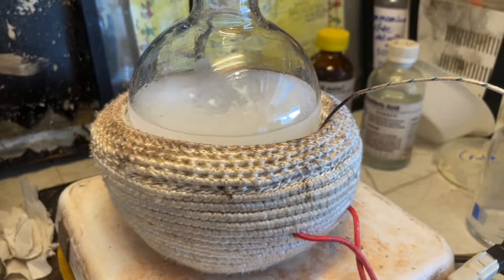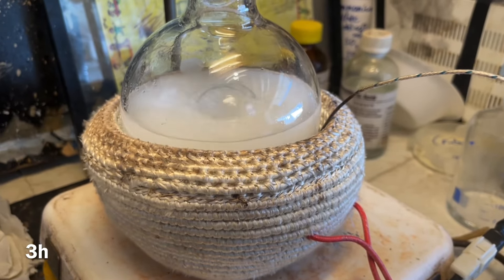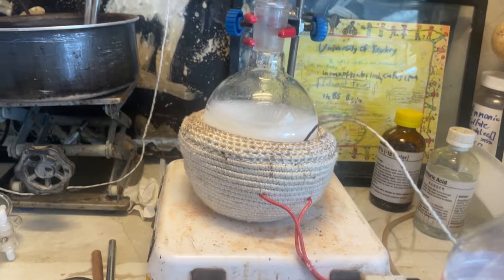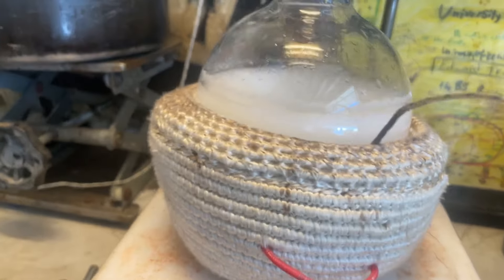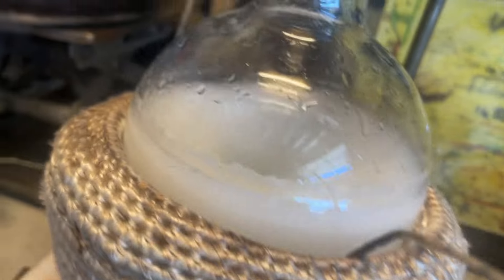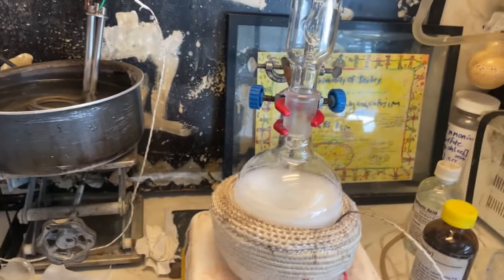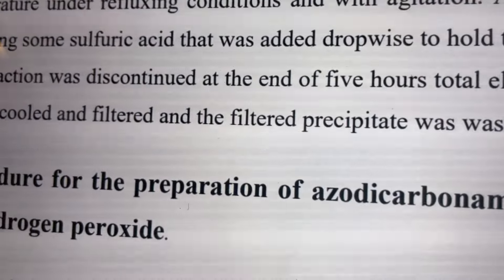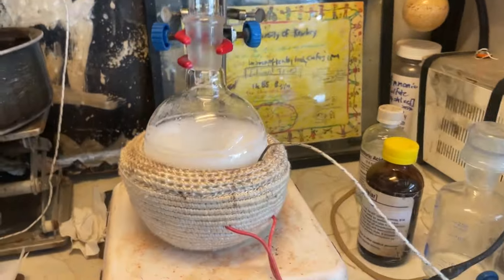I think that's biurea. One more hour and it's even whiter now. So I'll just keep letting this go. I got this for another hour. I'm blind. I didn't see it. It says you add sulfuric acid after two hours and reflux it for a total of five. So let's go ahead and do that. So I turn off the heat.